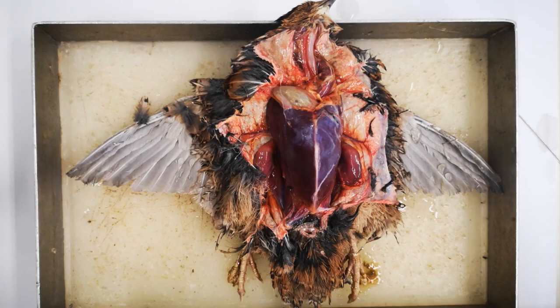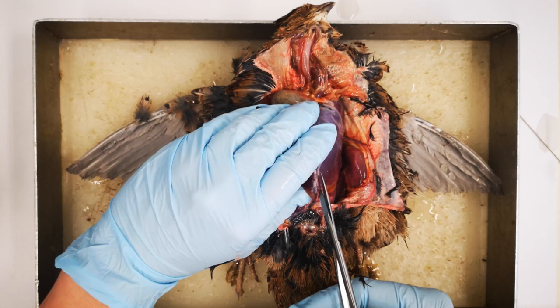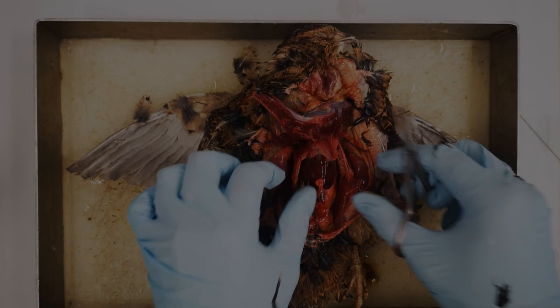One of the two chest muscles on the right or left is now cut off along the carina sterni. It is important not to cut too deeply so as not to injure the internal organs. Depending on the size of the preparation object, both muscles, and then the sternum, are removed. In order to separate the individual organs from one another, the connecting mesenteries must be carefully loosened with the hands, scissors, or a probe.